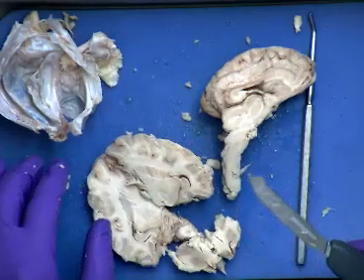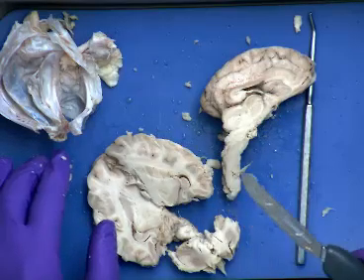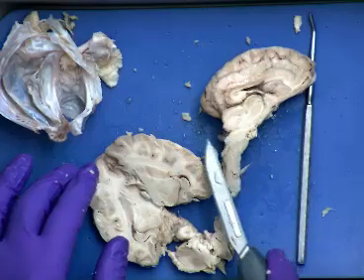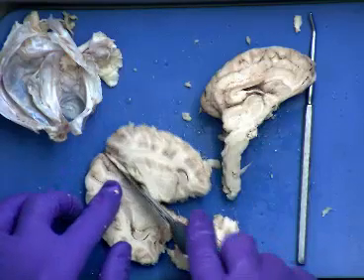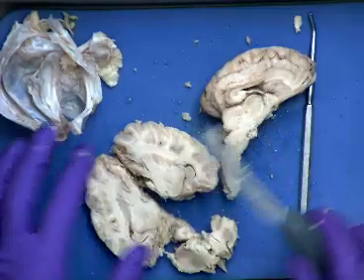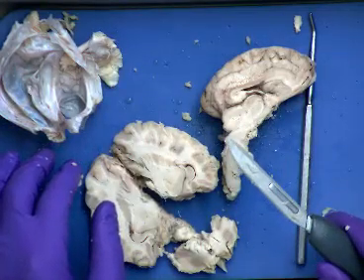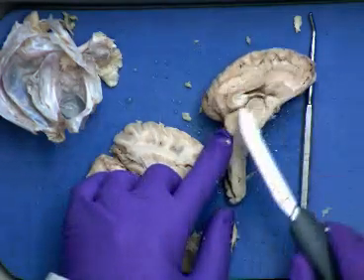What else do we see? Cerebral peduncles we talked about. Mammillary body, I wouldn't worry about mammillary body. Cerebral aqueduct, we couldn't quite see it in mine. And then fourth ventricle also would tend to be here. It's going to be just anterior to the cerebellum. So that's part of what you get when you go to an actual organ, is that it's not going to be perfect like the model. But most of those structures that we saw, probably 80% of the structures on the list that we have there, we could actually see on the sheep brain itself.